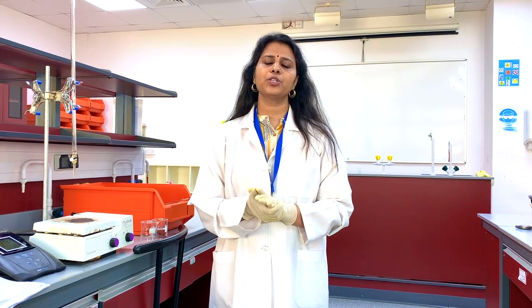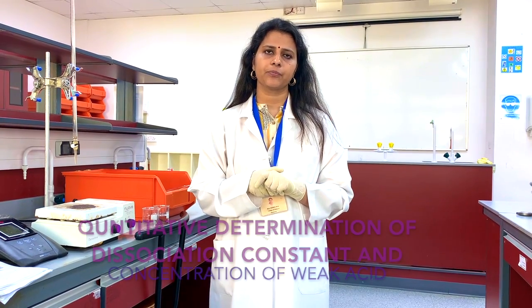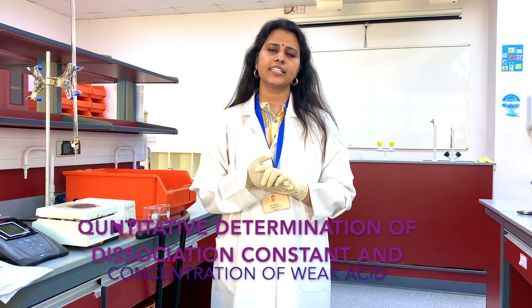Today, we are going to perform the experimental determination of the dissociation constant of a weak acid and the concentration of the weak acid. The aim of the experiment is to become familiar with the operation of a pH meter and the quantitative determination of the dissociation constant and concentration of a weak acid.